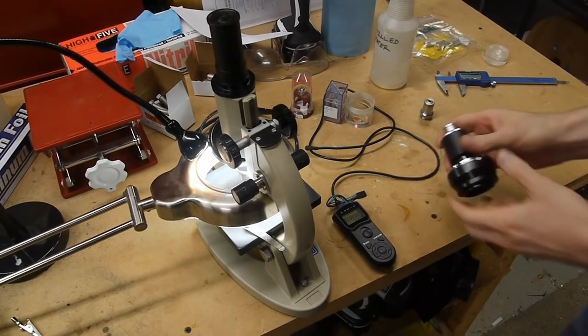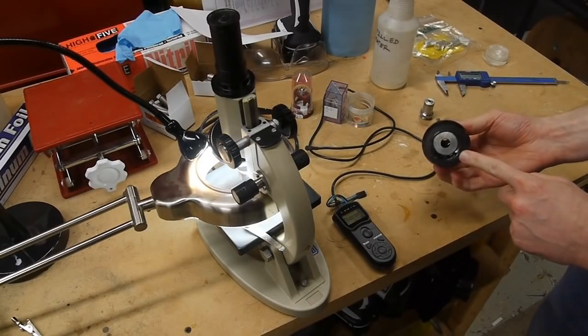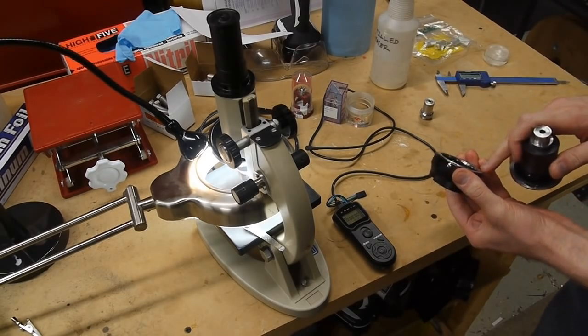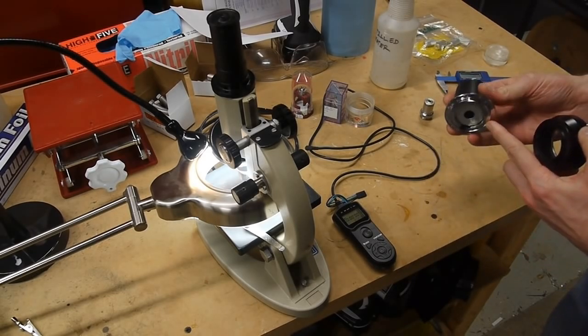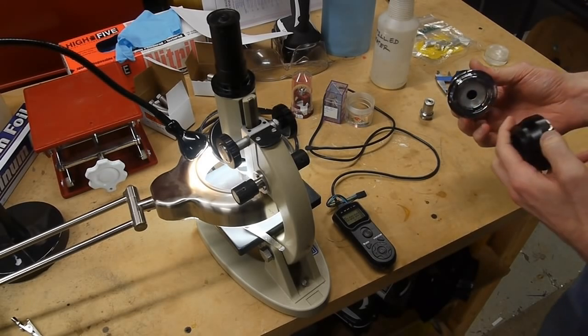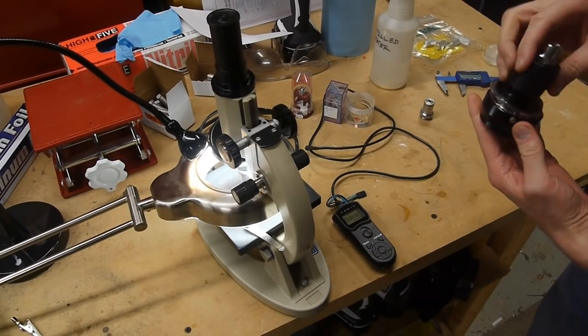For some stuff, I use this, which is just a microscope objective put onto a bunch of adapters, and then this goes right onto the camera. So this is a micro 4/3 to Nikon adapter, and then this side is a thing that I made from a Nikon lens that died, and I glued a washer in there, and then machined a couple pieces of plastic for it.